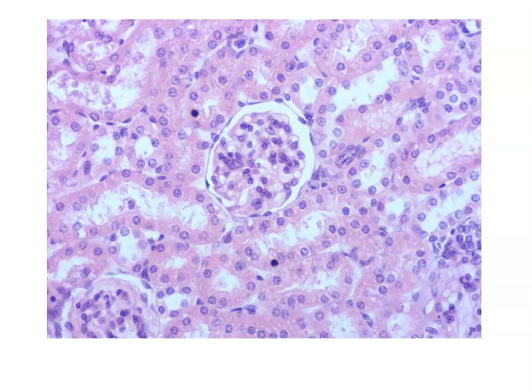Now, remember when we identify or classify epithelium, we look for 2 things. First, we look at the number of layers. If it's 1 layer, then of course it's a simple epithelium. If it's many layers, we call it stratified. Then we look for the cell shape at the apical surface of the epithelium, and we have our 3 shapes.